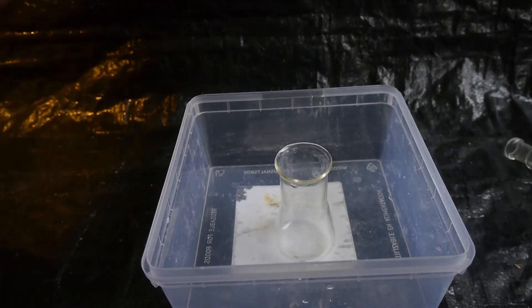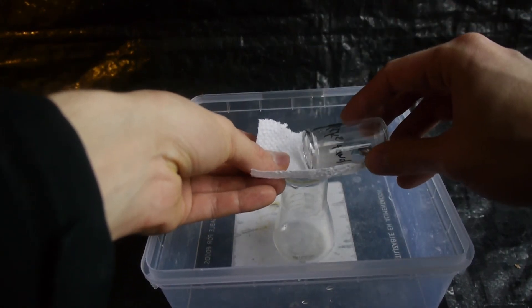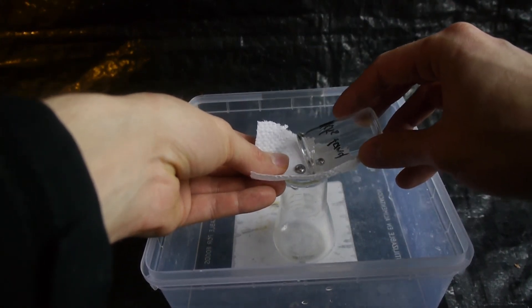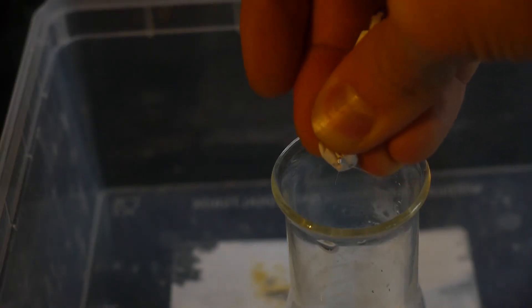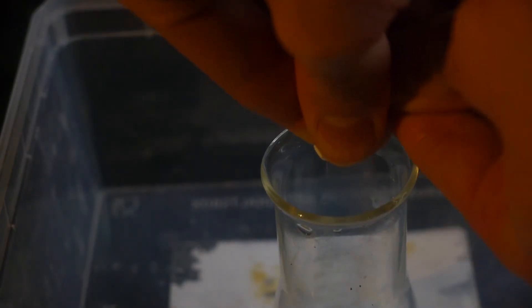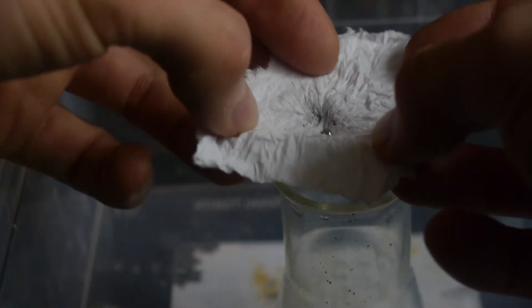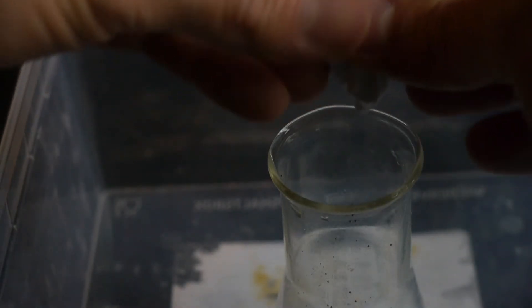Now to make absolutely sure we haven't missed any gold in the mercury, let's squeeze the residue from the distillation through a paper towel. And now let's see how much gold we've caught here in this paper towel. Oh, and I've spilled a bunch. That's why I had the tub underneath. Well, no gold. But it still removed some impurities from the mercury. Which is very nice.